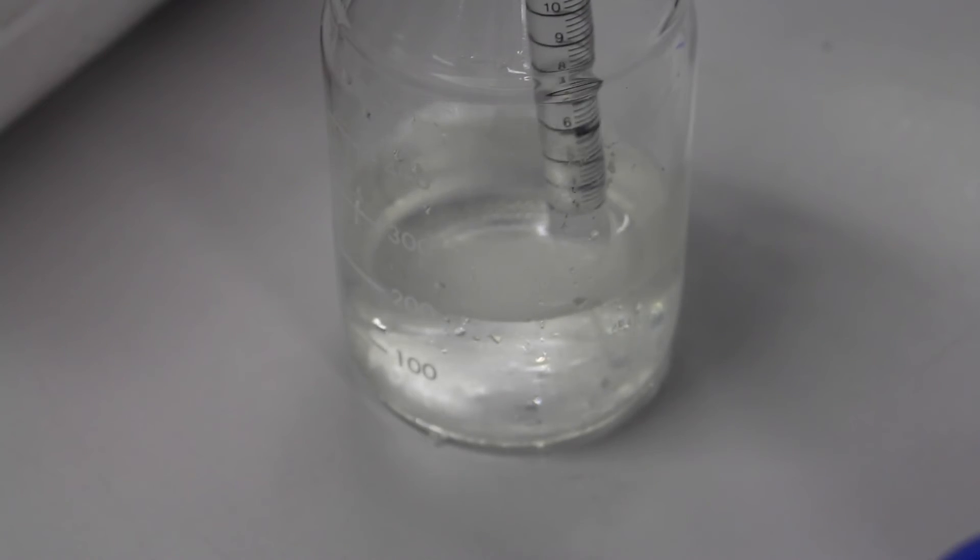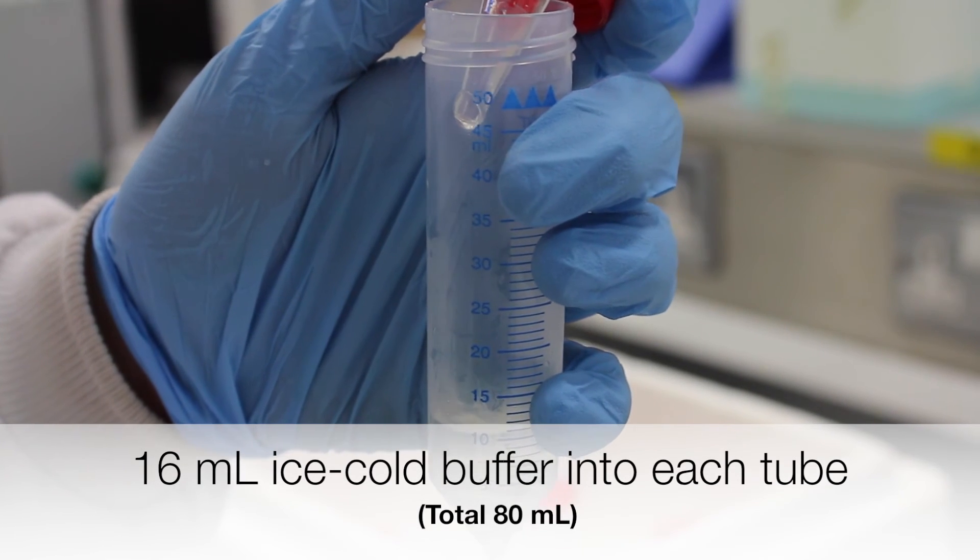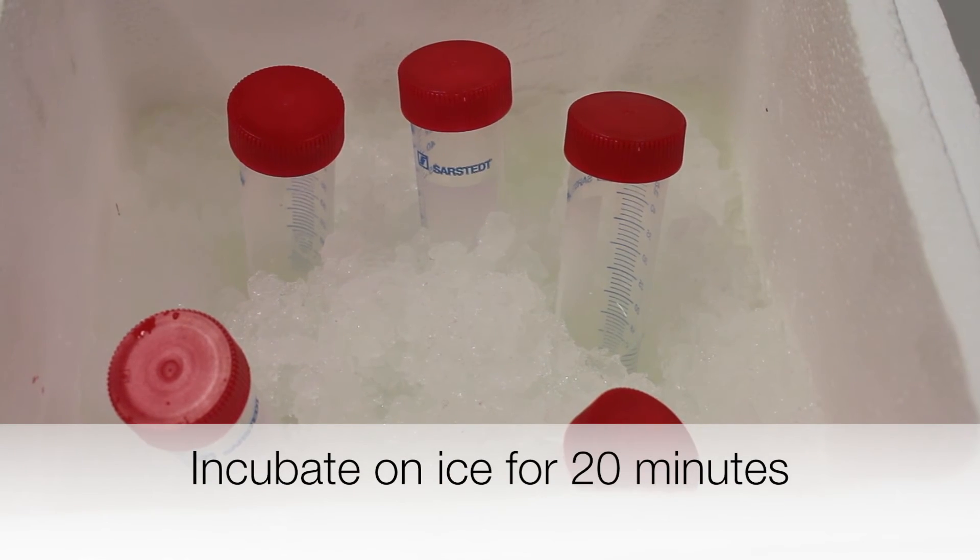The pellets are re-suspended by adding 16 ml of ice-cold CCMB-80 buffer into each tube. The re-suspended pellets are left to incubate on ice for 20 minutes.